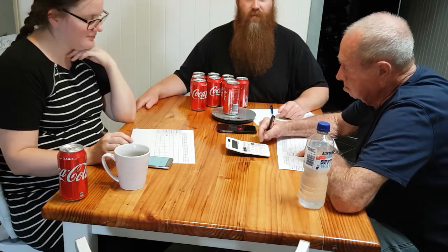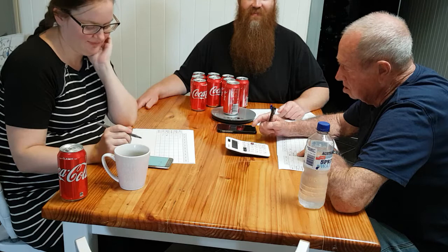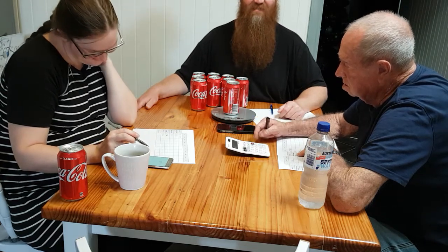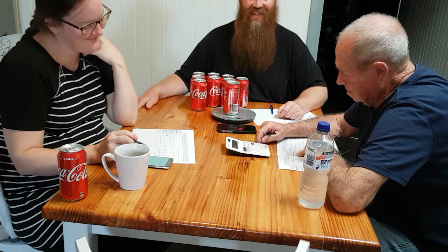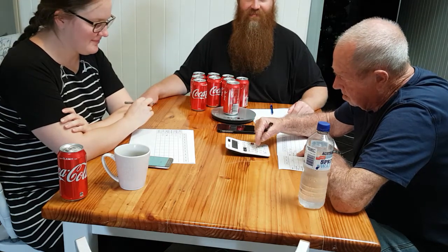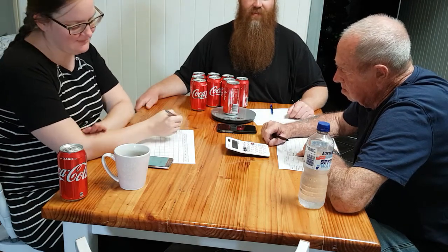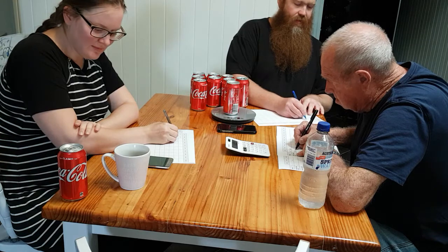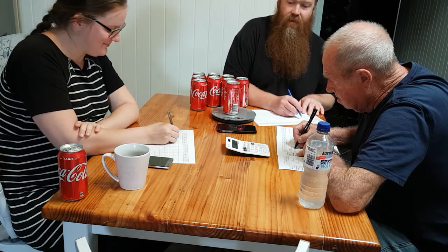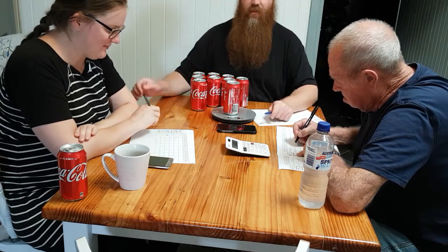Right, which one do we press now? So minus. That's minus, isn't it? Yes, I'm just going to make sure. Minus what? 13.55, which is written here in the next step. Minus can body, 13.55. And then we press the equal button. So then we write down 395.49. Oh, 5, sorry, I can't quite see the calculator figure correctly.